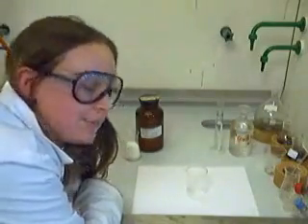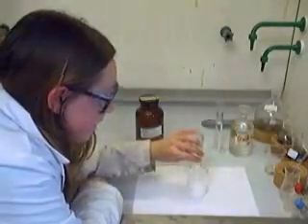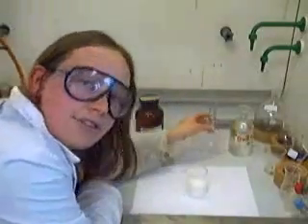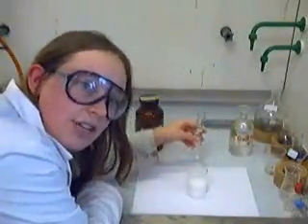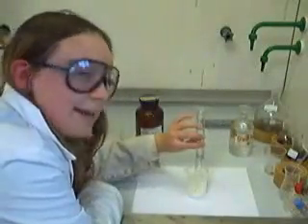Sugar is a good example of something in your everyday home that contains carbon. Sugar is made up of carbon, oxygen, and hydrogen. We're going to put it in this beaker here and add some sulfuric acid. The sulfuric acid is going to take away the hydrogen and the oxygen from the sugar, which will leave us with carbon. And as everyone should know, carbon is black.